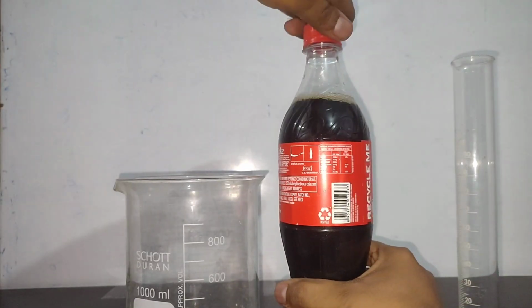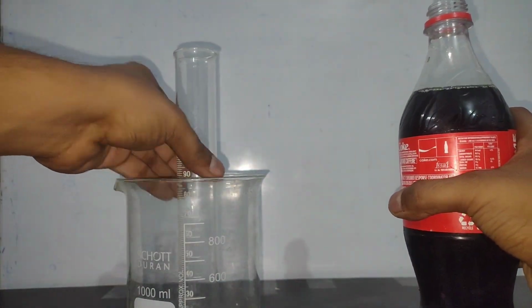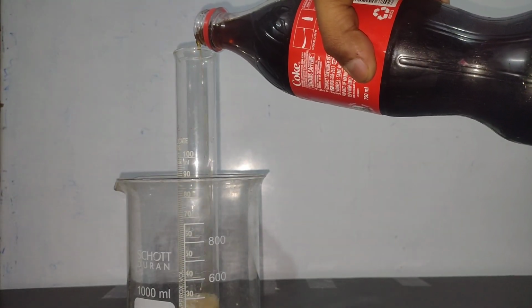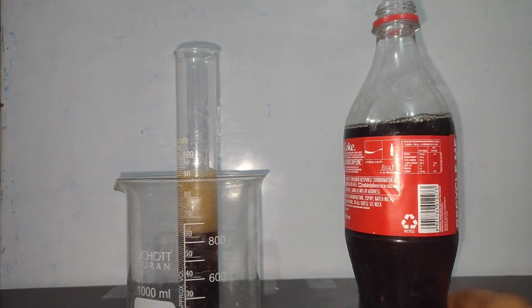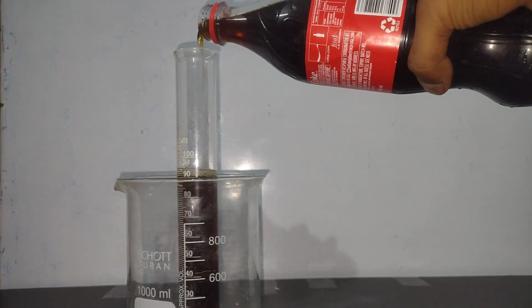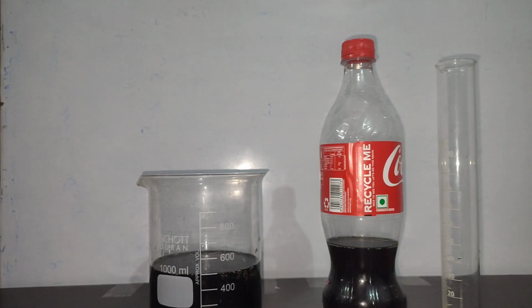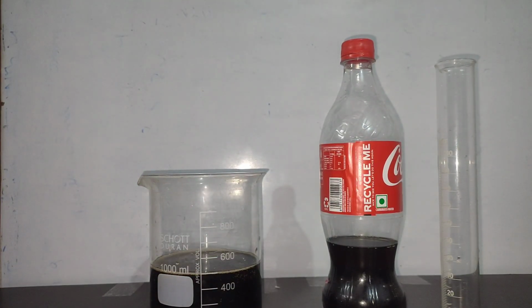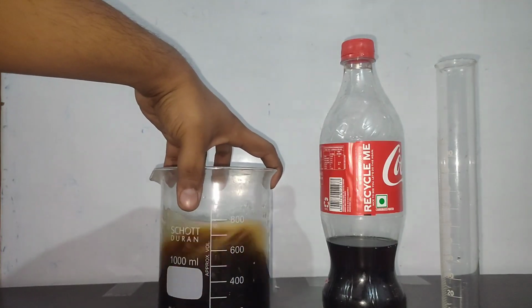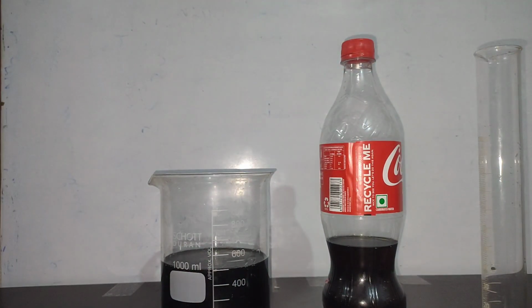So to find out how much phosphoric acid is present inside this, I took out 500 ml of Coca-Cola with a 100 ml measuring cylinder. So I have to measure 100 ml Coca-Cola 5 times, and I poured this into a 1 liter beaker. Now to it I added some ammonium chloride and swirled it to dissolve it. Then I will add some ammonium hydroxide.